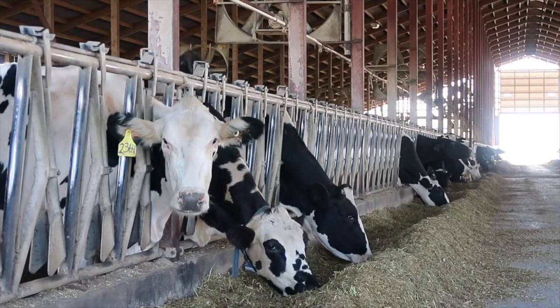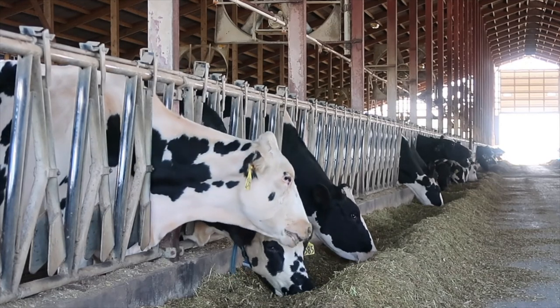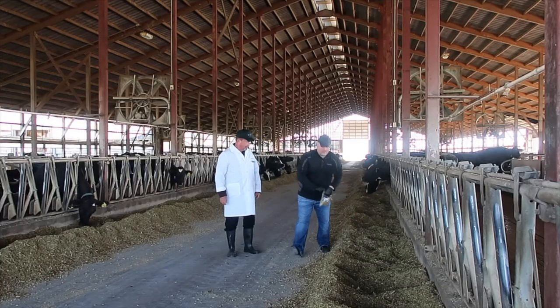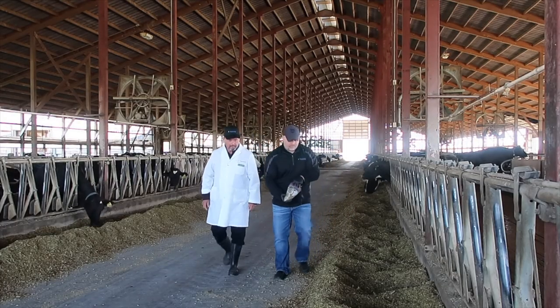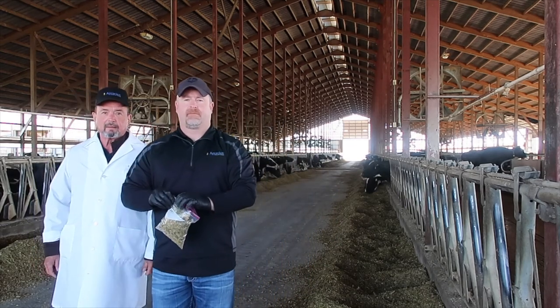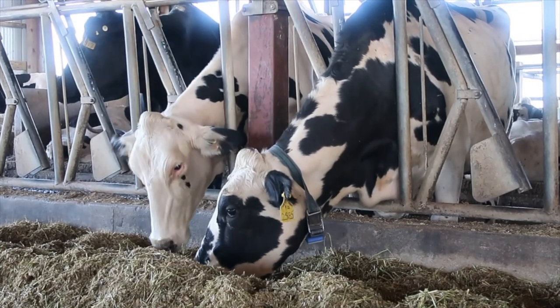I noticed the cows behind us seem content with their TMR — there isn't a great deal of sorting going on. But many times when we sample, there will be a lot of sorting. Do you collect some of that sorted feed? My first priority is the feed the cows are consuming, so the first sample must be the feed that is still in front of them. I may well take a second sample concentrating on the sorted materials. Both my customer and I might like to know if mycotoxin concentrations prompted some of that sorting. If you have questions about sampling procedures, please give us a call.